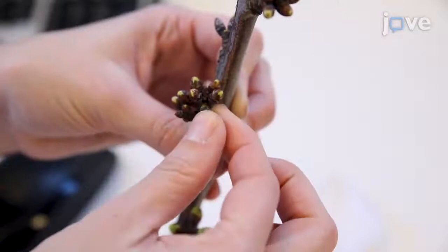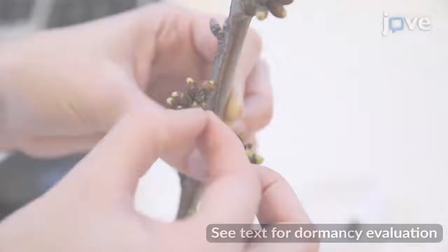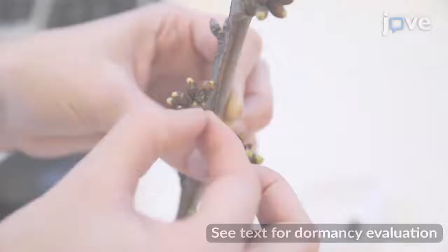Every week, from the beginning of autumn until bud burst in spring, evaluate the growth of the flower buds. Remove the external bud scales from each sample.